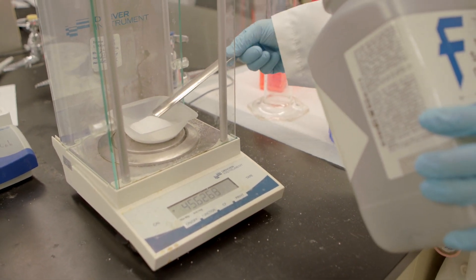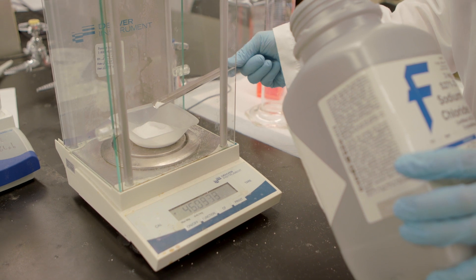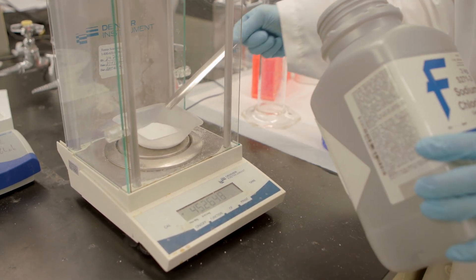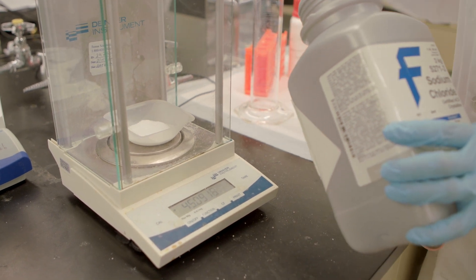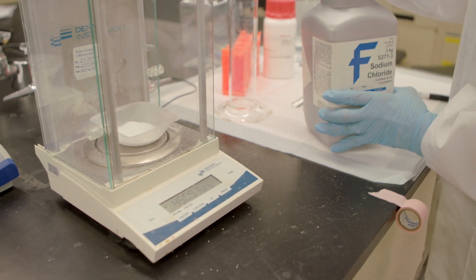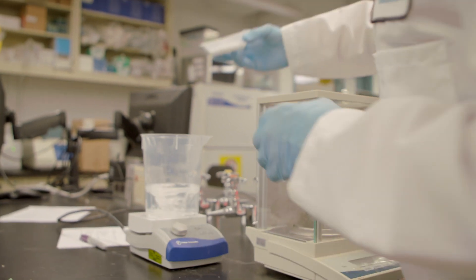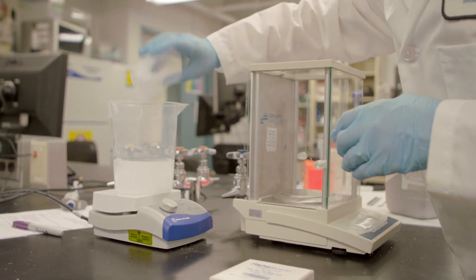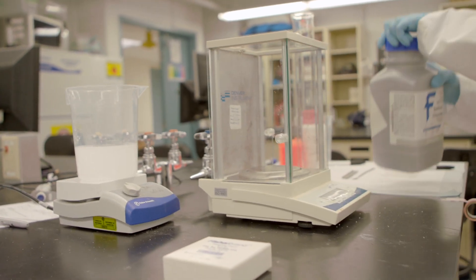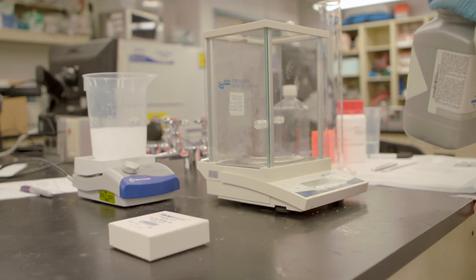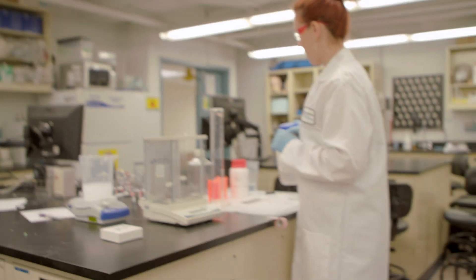If I go a little over, I can remove some. There we go, 45.09. So I would note that in my notebook. Then I take the NaCl and pour this into a solution. Just mixing nicely. It's good practice to always close your chemicals as soon as you're done using them, so you don't risk them to knock them over.